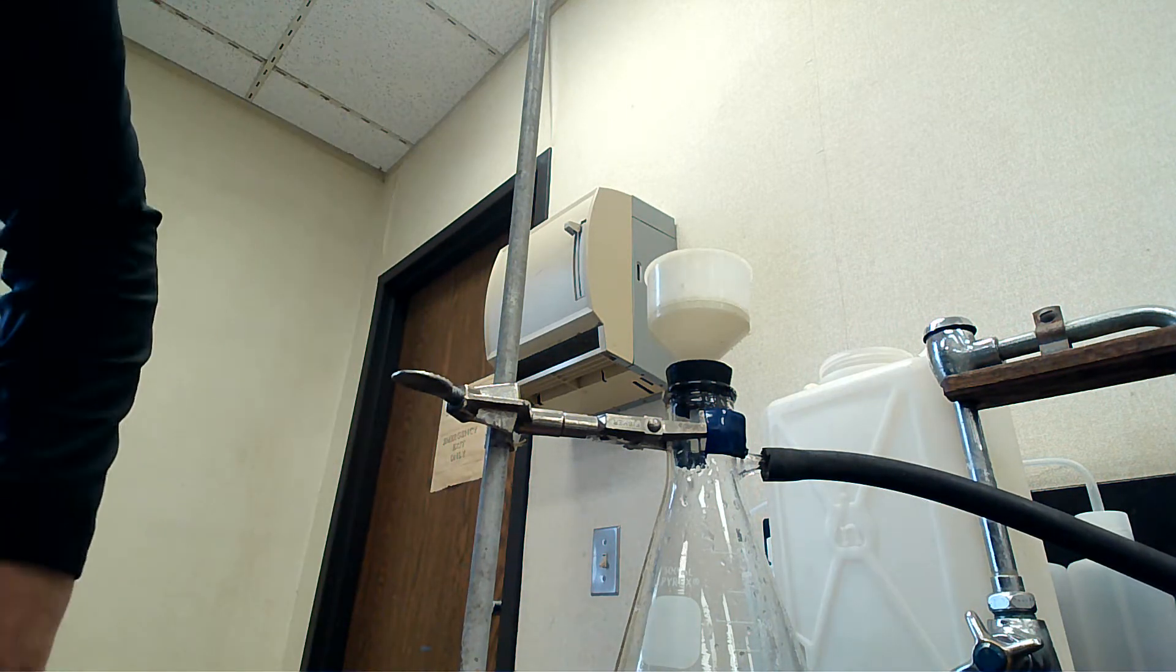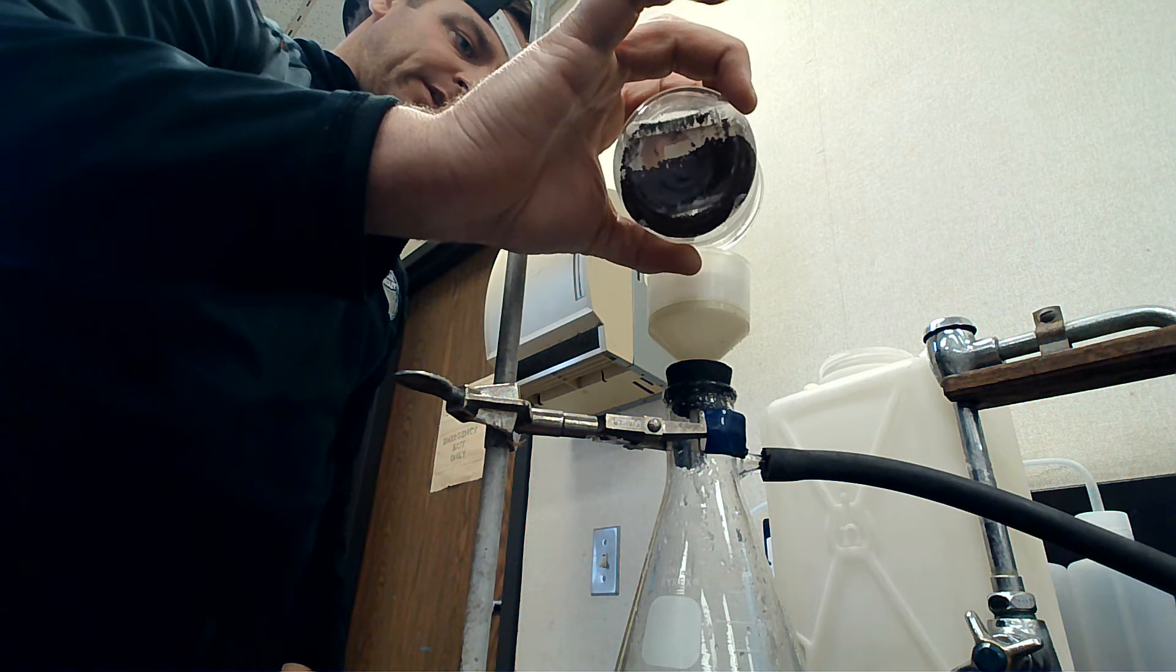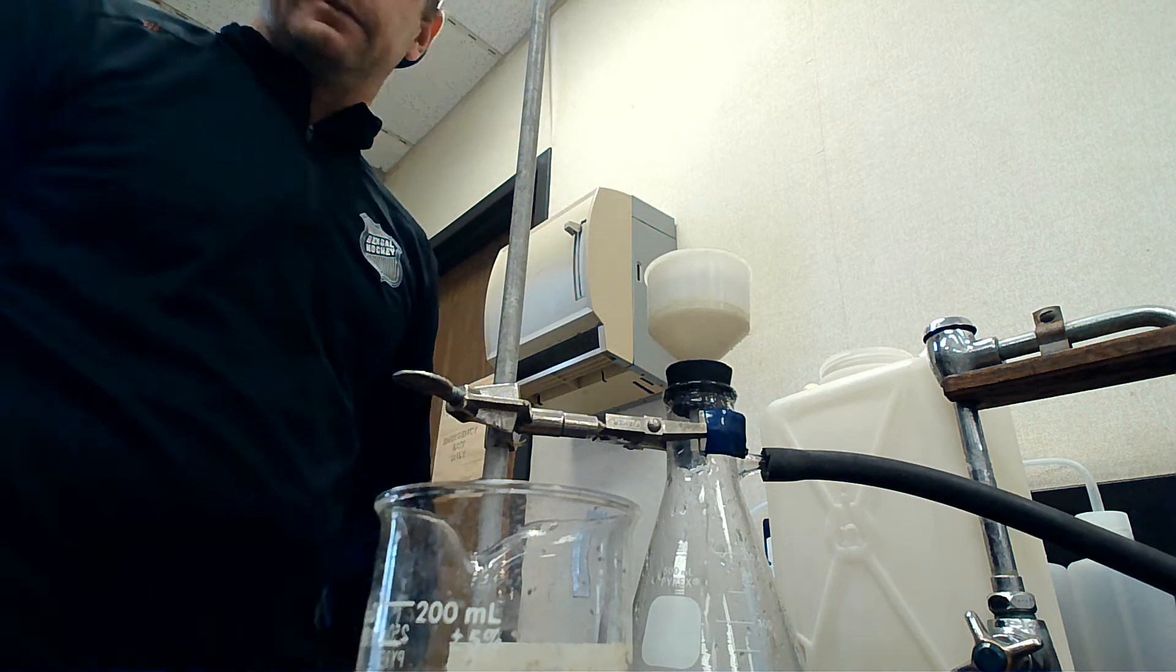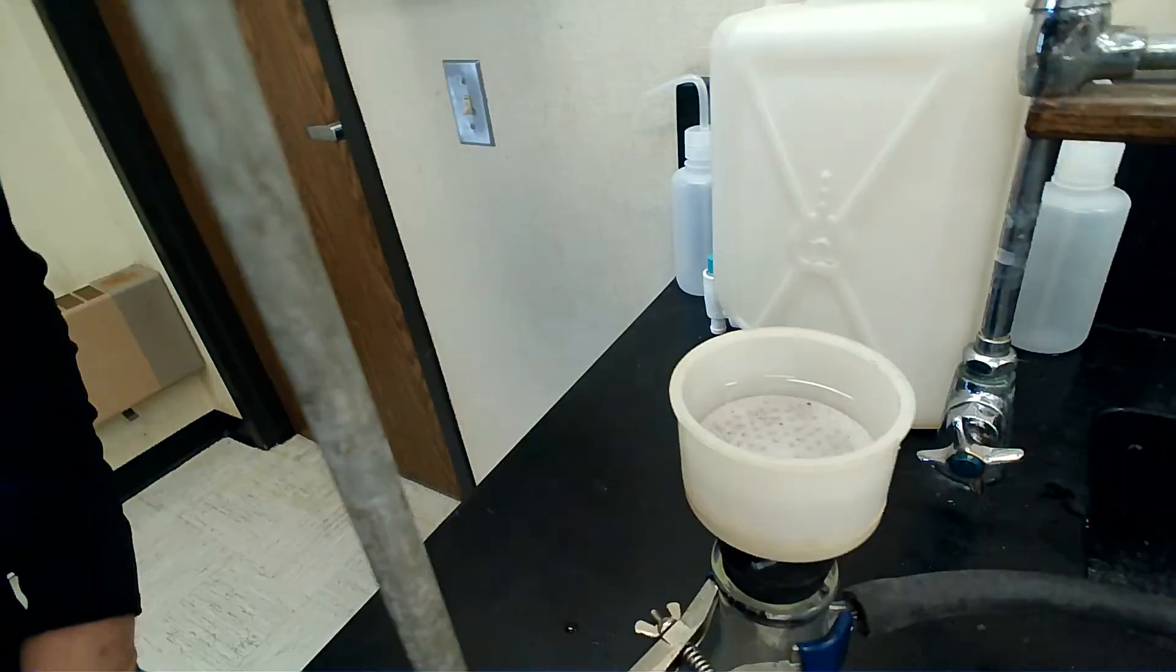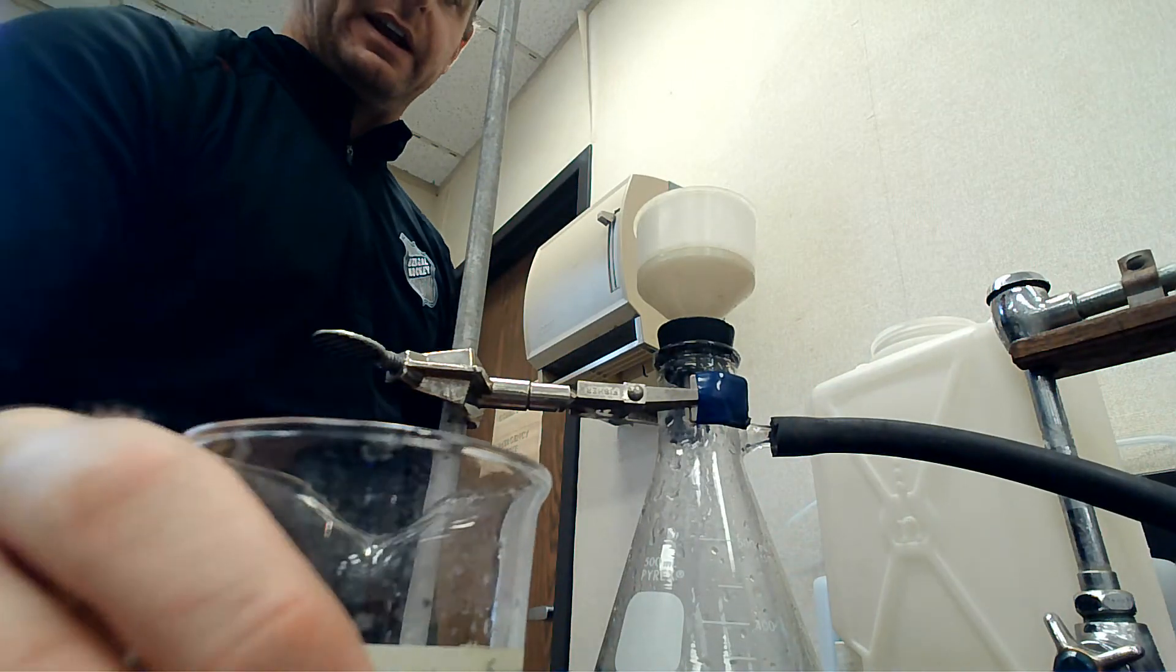What I do is pour the liquid through. The liquid's going to go down underneath, and we're going to collect the copper up top. It's a great way for us to separate anything.